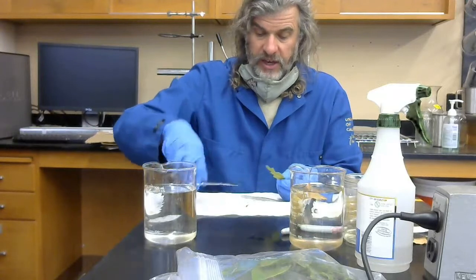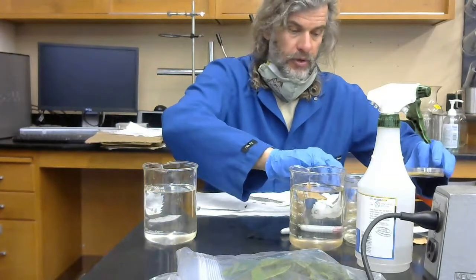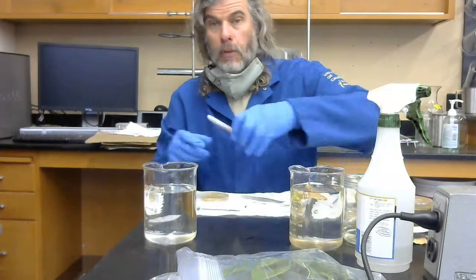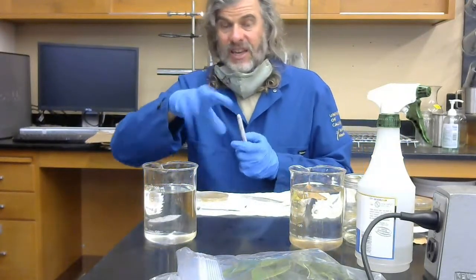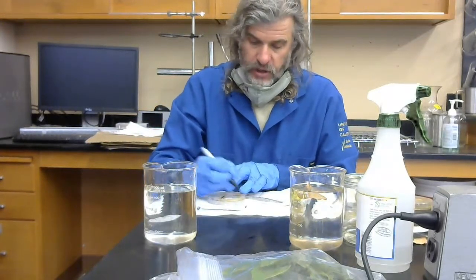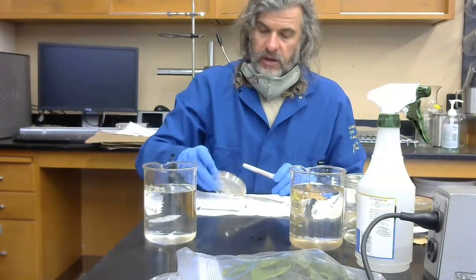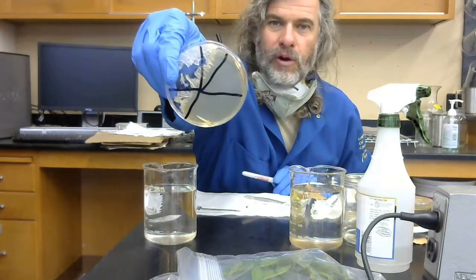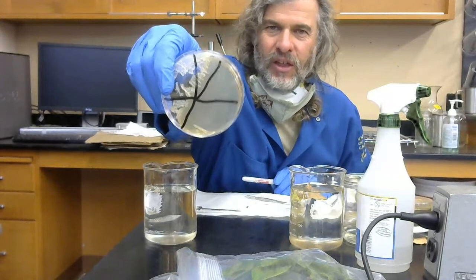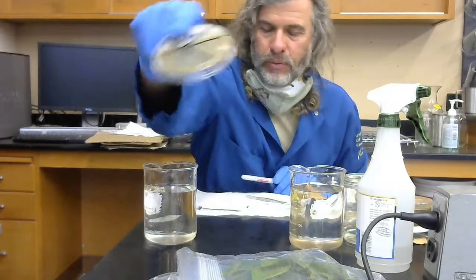So anyway, I've got these here. I've got my set of little things here, and I'm going to put them into my plates. Remember, mark your plates on the bottom because the lid will rotate, and you'll lose track of what you have sampled. Here is a rather poor division of the media. I did a bad job, and if I was doing this for real, I would go back and erase this using ethanol or isopropyl, and I would remark it.